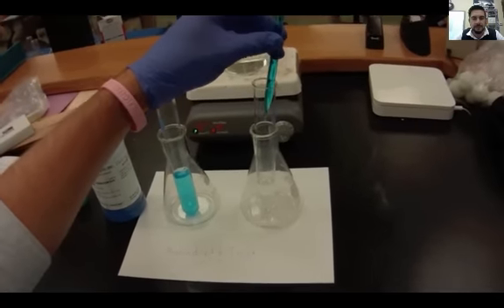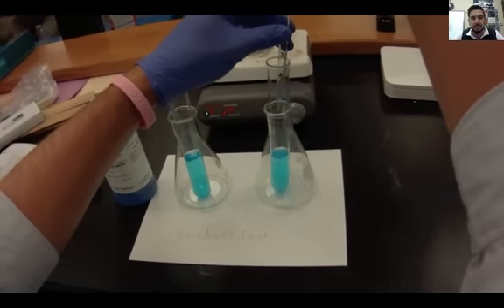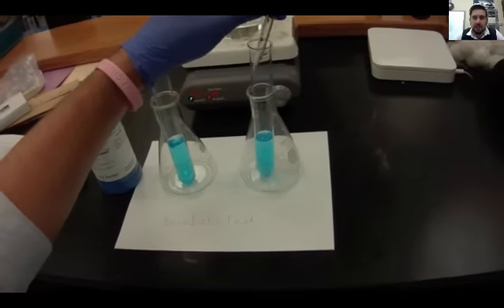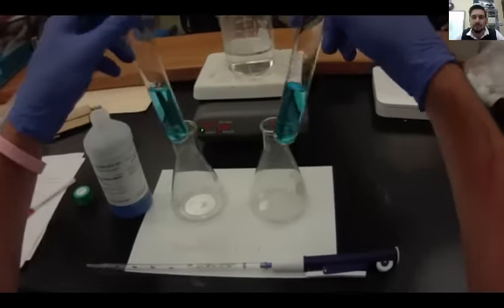Anytime now, whenever you're ready. All right, there we go. Now it does require some heating, so I'm going to put these on the hot plate real quick to give you guys an idea of how this works.